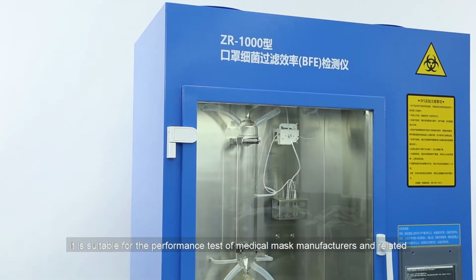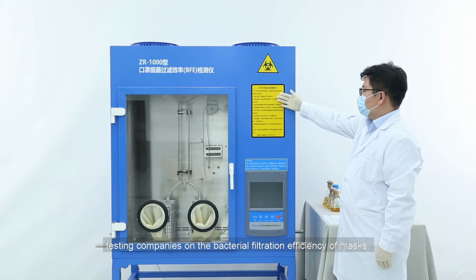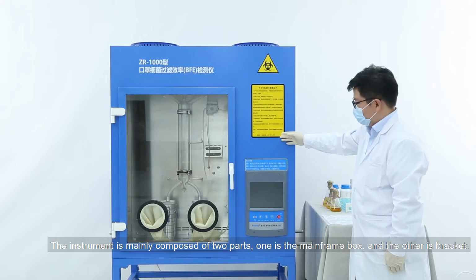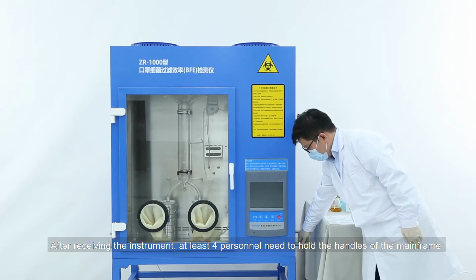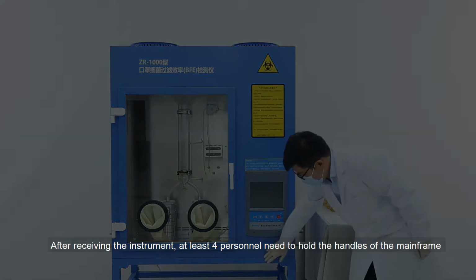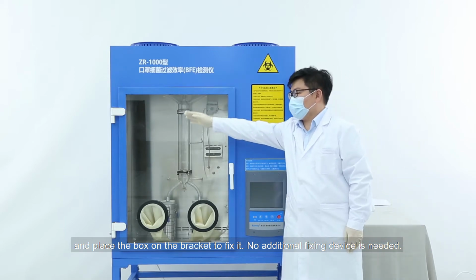It is suitable for the performance test of medical mask manufacturers and related testing companies on the bacterial filtration efficiency of masks. The instrument is mainly composed of two parts. One is the mainframe box, and the other is the bracket. After receiving the instrument, at least 4 personnel need to hold the handles of the mainframe and place the box on the bracket to fix it. No additional fixing device is needed.